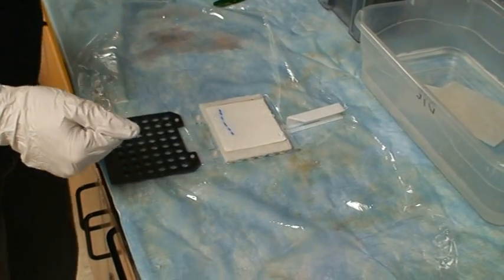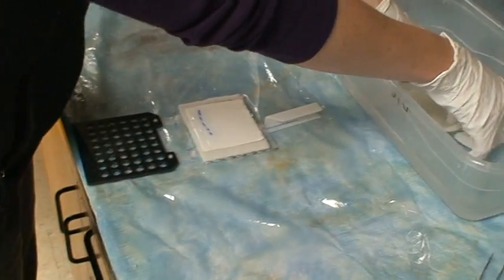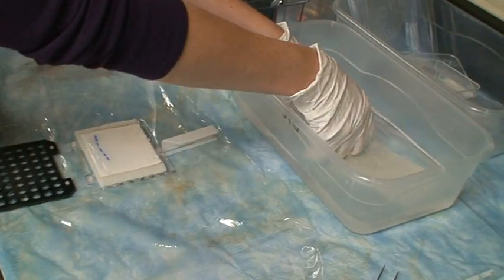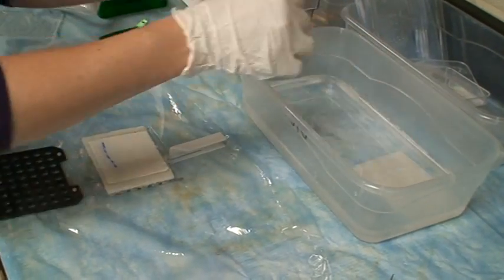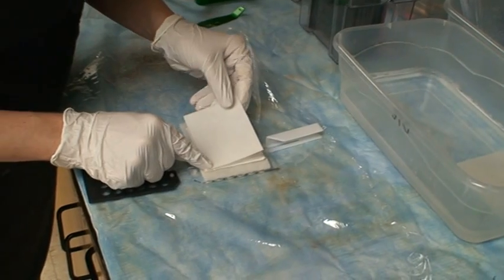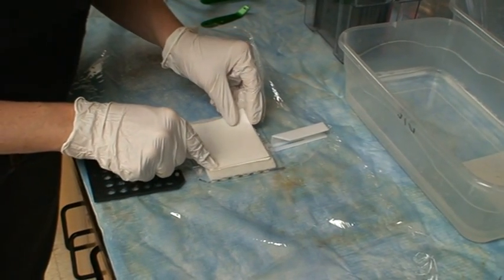I've gotten my gel positioned on my membrane and now I'm ready to add the next piece of filter paper. So I get that out of the dish that it's been soaking in. I again lay that, building my sandwich.